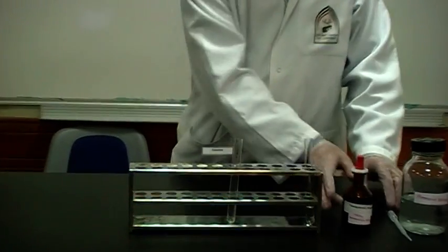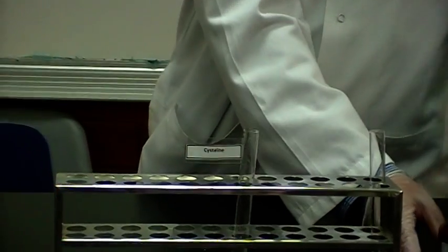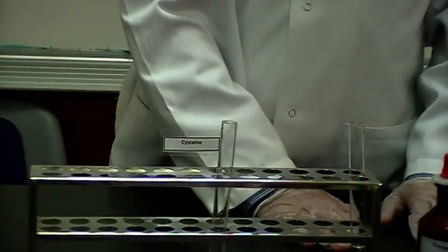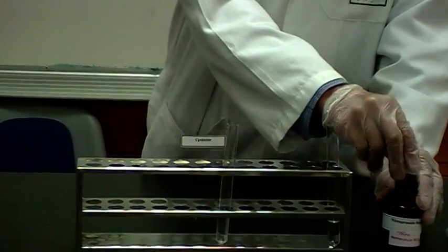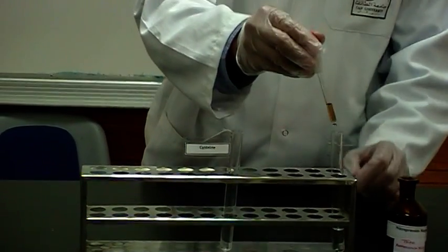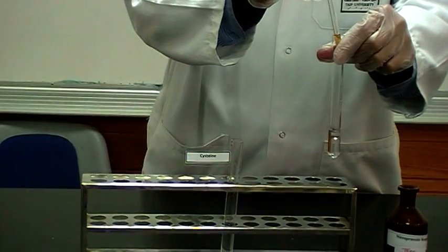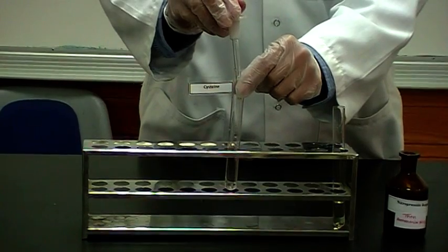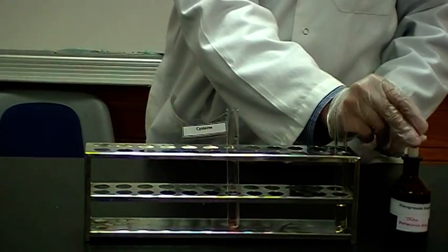What do you need? The reagents are nitroprusside solution and ammonia solution. So let's add a few drops of nitroprusside solution here, here, there, and then don't forget to mix very well.